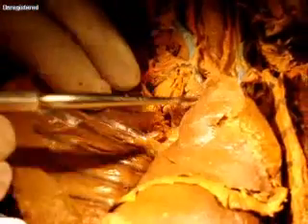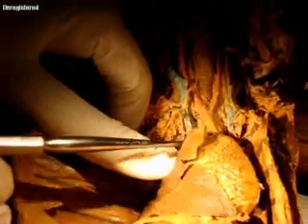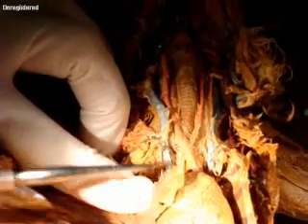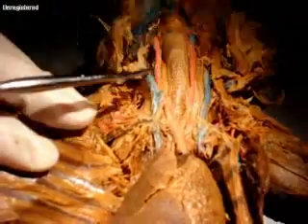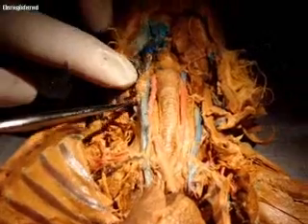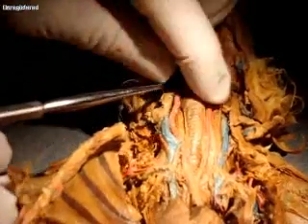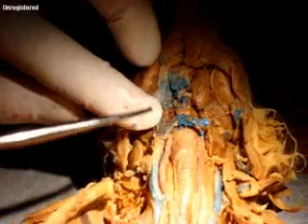So that's going to go in. Right up above it, coming from the top down, you've got this big vein here — this is going to be the right cranial vein. So you have two superior vena cavas, and this is the right cranial vena cava. As you go up, that becomes the external jugular. Then the external jugular splits — one of them is the internal jugular, and I think this little stump here that's been broken off might be the internal jugular. There's also a part that crosses like a strap — that would be the transverse jugular, and that's also broken off.